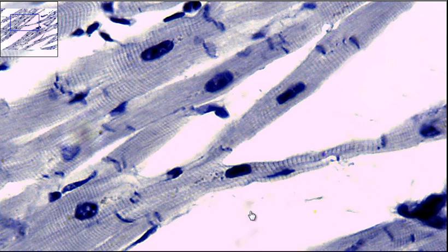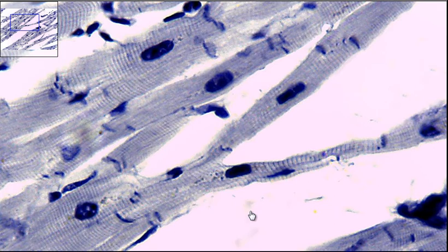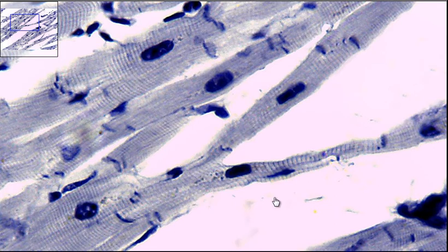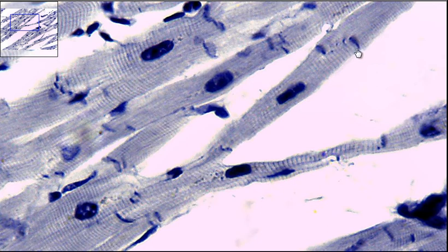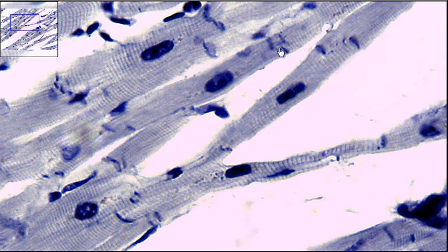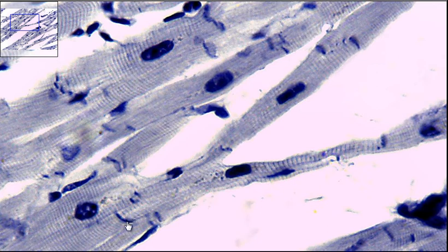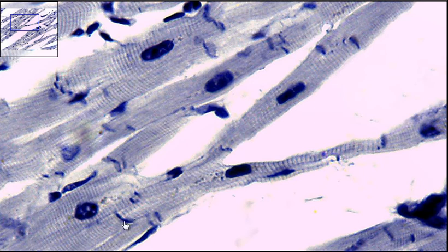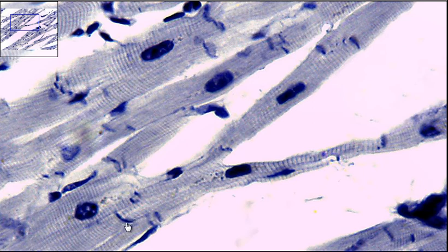You'll also notice that there's some darker lines going across the cells. These lines are called intercalated discs.